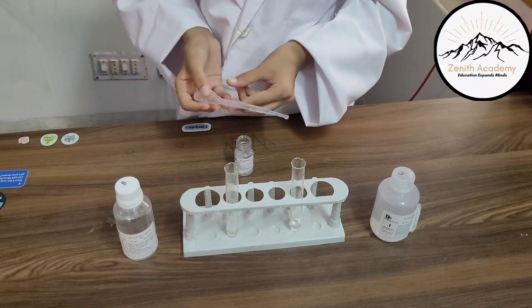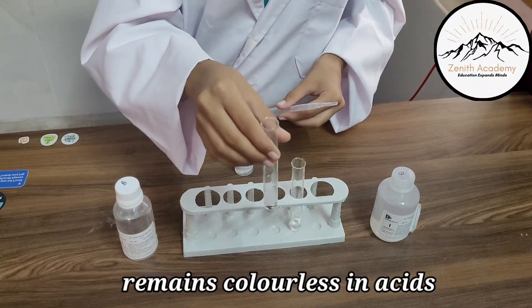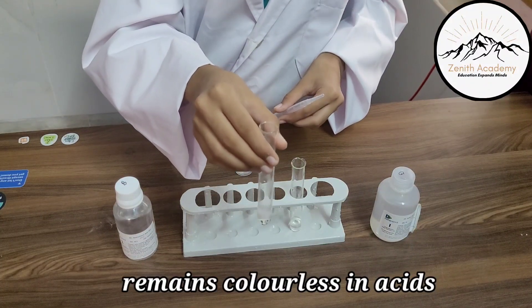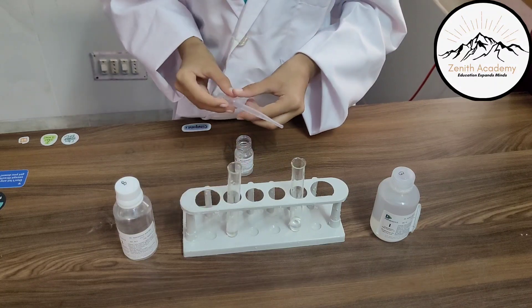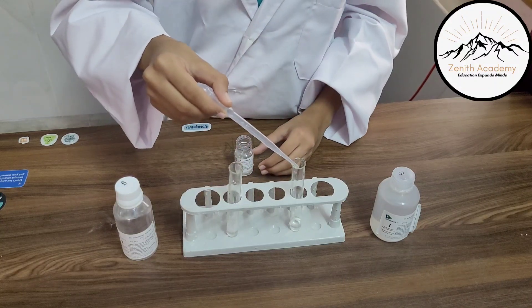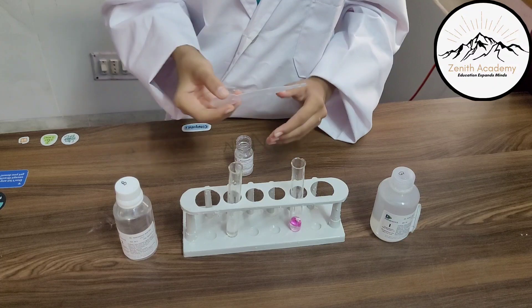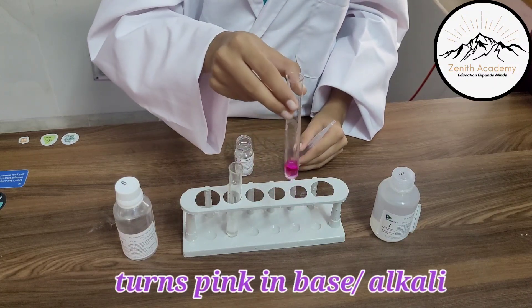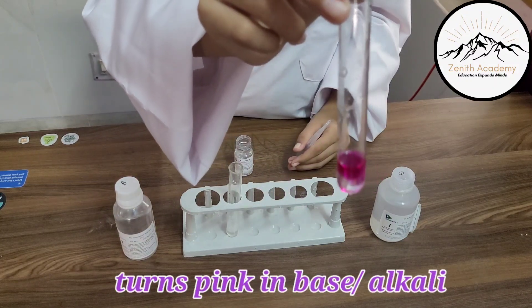If we add a few drops of phenolphthalein indicator into an acid — in this case hydrochloric acid — it shows no change in color. Whereas if even a drop of phenolphthalein is added into a base, it shows a brilliant pink color.